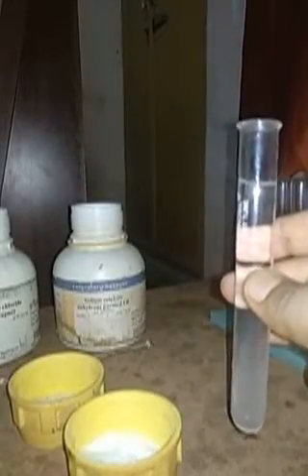Now we are going to perform an activity. We are going to mix this solution of barium chloride and sodium sulfate into another test tube. I am going to choose this test tube for the experiment. You can see here, now I have taken the solution of barium chloride into it, and I am going to add the sodium sulfate into it, and let us see what happens.